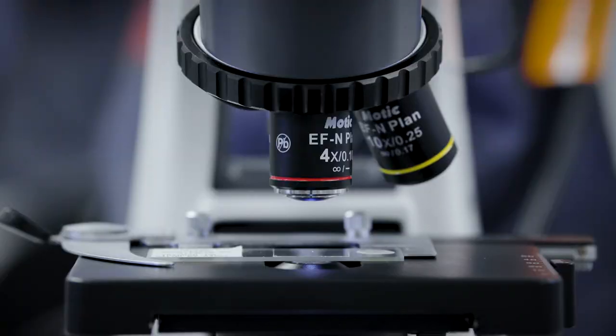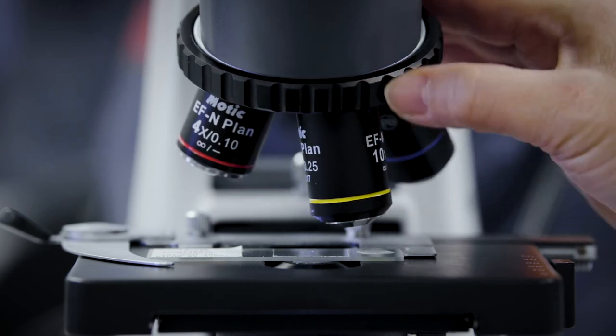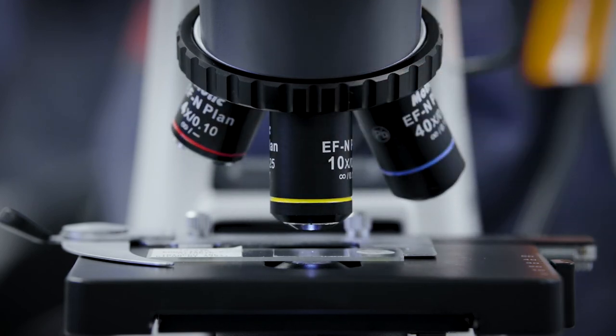This microscope is parfocal. The focal distance between objectives is very similar. When there is a change of objectives, only fine focus is required.